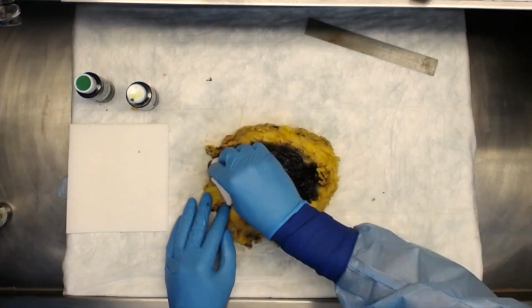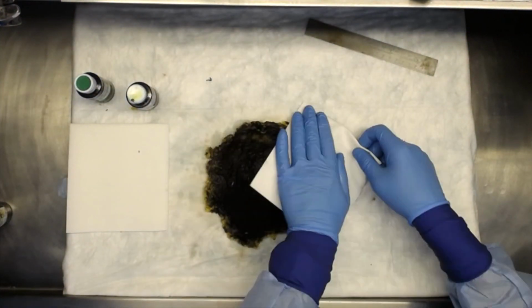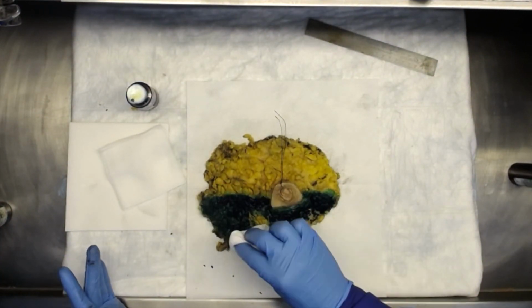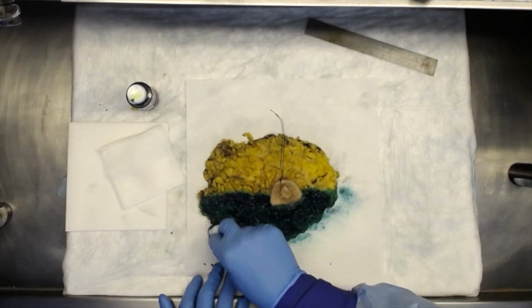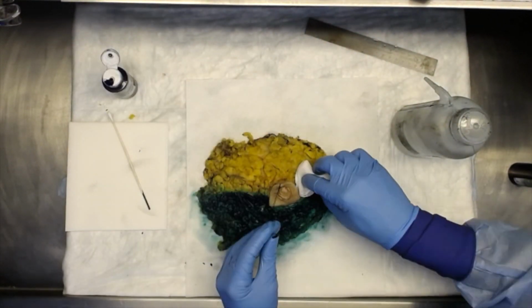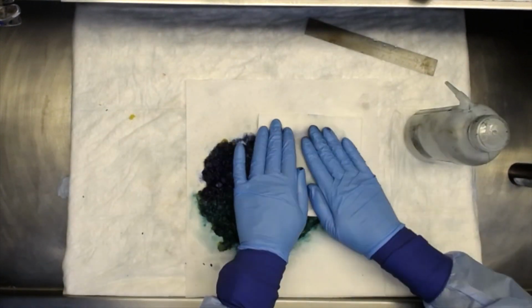Carefully document the orientation of the specimen by using 3 different ink colors. Deep/posterior is inked black, anterior and inferior is inked green like the grass, and anterior and superior is inked blue like the sky. Make sure to use vinegar to fix the ink to the tissue.